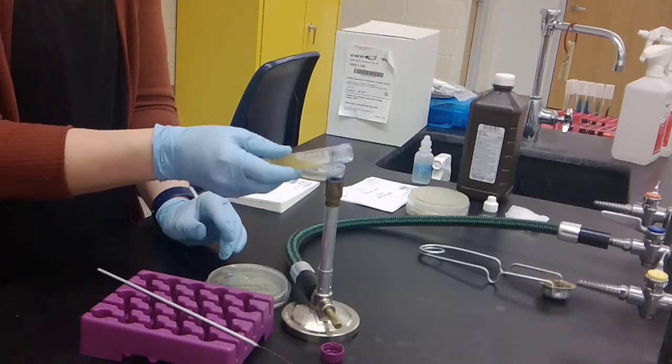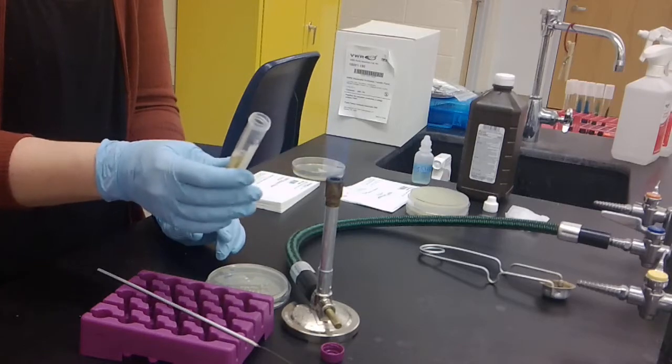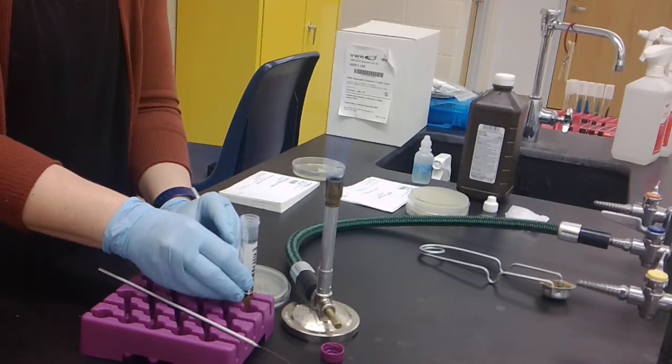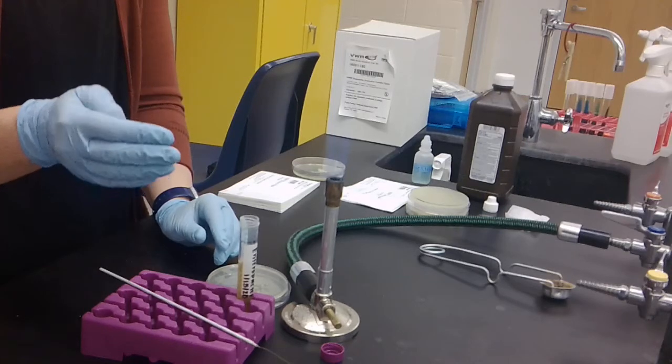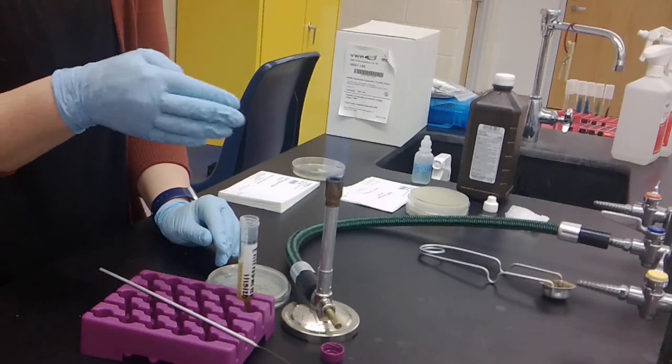You're then going to very quickly take the mouth of the tube through the flame a few times. This kills any bacteria that are on the outside of the tube. You don't need to hold it in the flame; you can move it through very quickly.